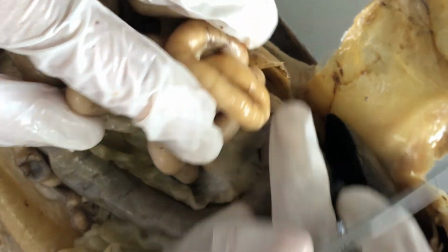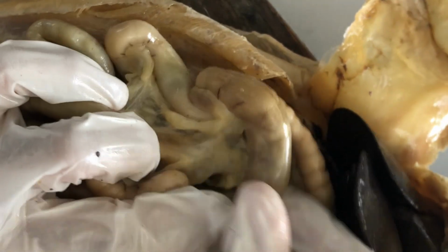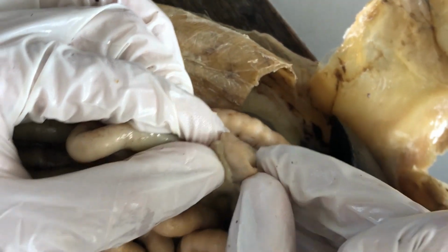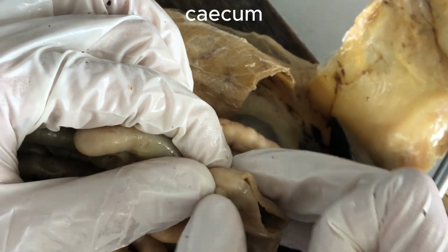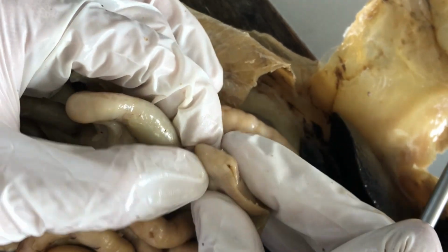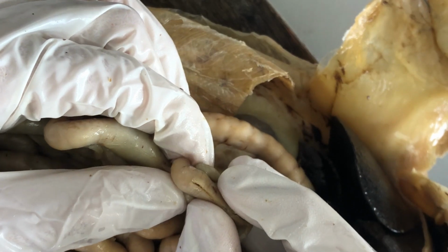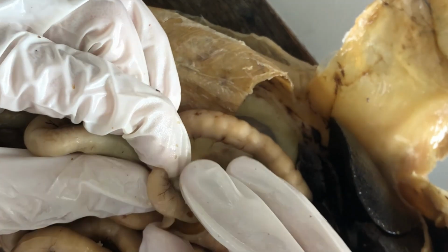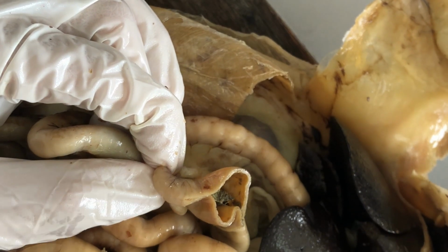So that's the large intestine, or colon portion of the large intestine, and it has segments just like the small intestine. So immediately after the ileum, there's a blind pouch here of the colon. That's the cecum. The cat is not a good example or specimen for showing the cecum because it's a carnivore. The main function of the cecum is for hindgut fermentation. So typically the cecum houses a lot of symbiotic, mutualistic microbes, bacteria, that will aid in digestion of plant matter, for example, cellulose.